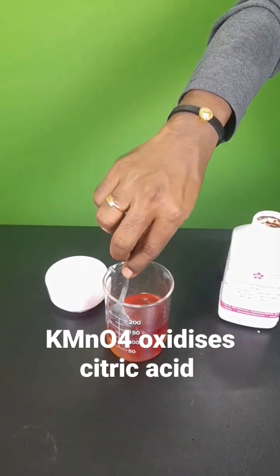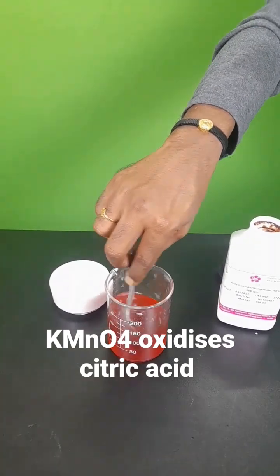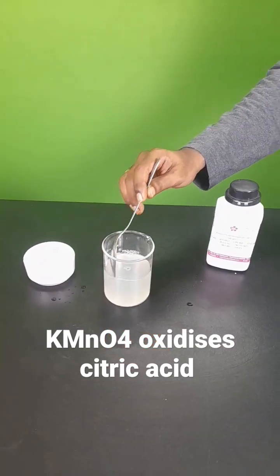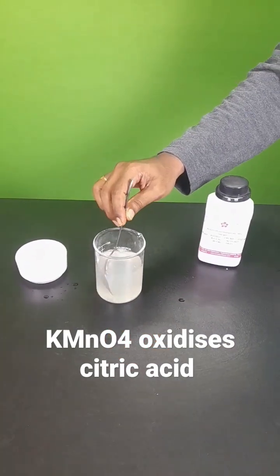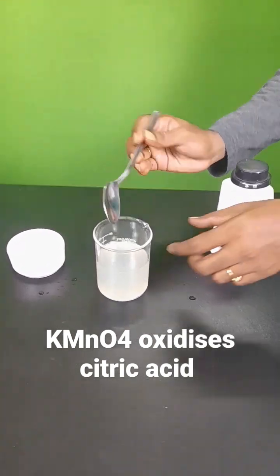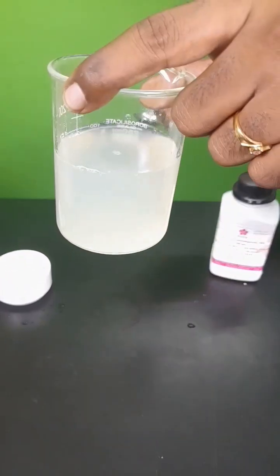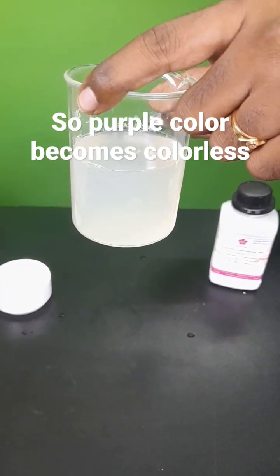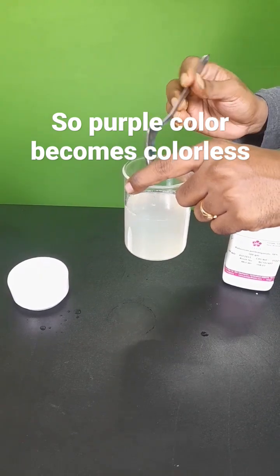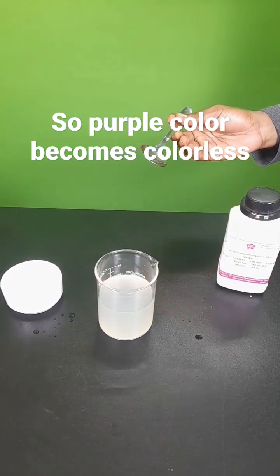We mix it well. After some time, you must have noticed this color — almost the KMnO₄ dark purple color has become colorless. Can you guess the reaction? If you guess it, post it in the comment box.